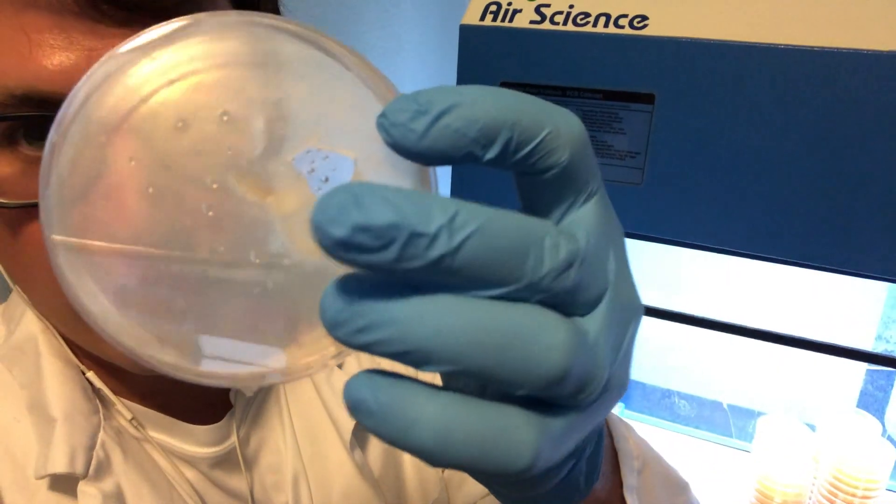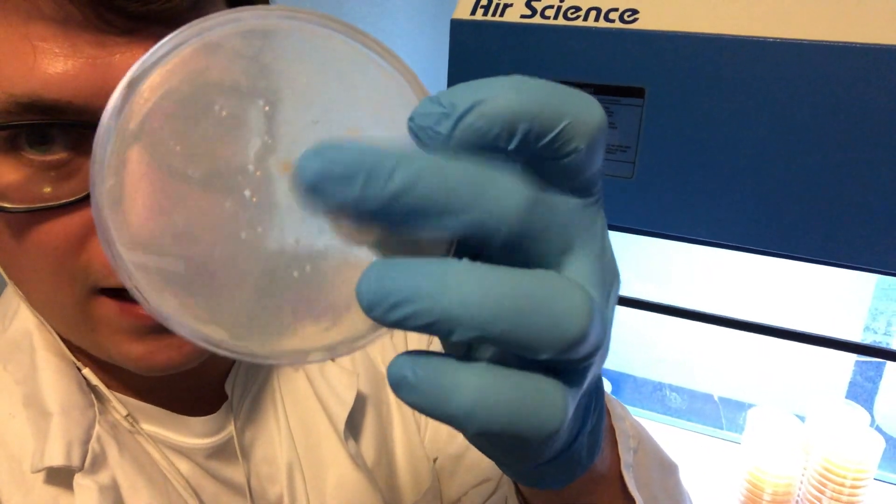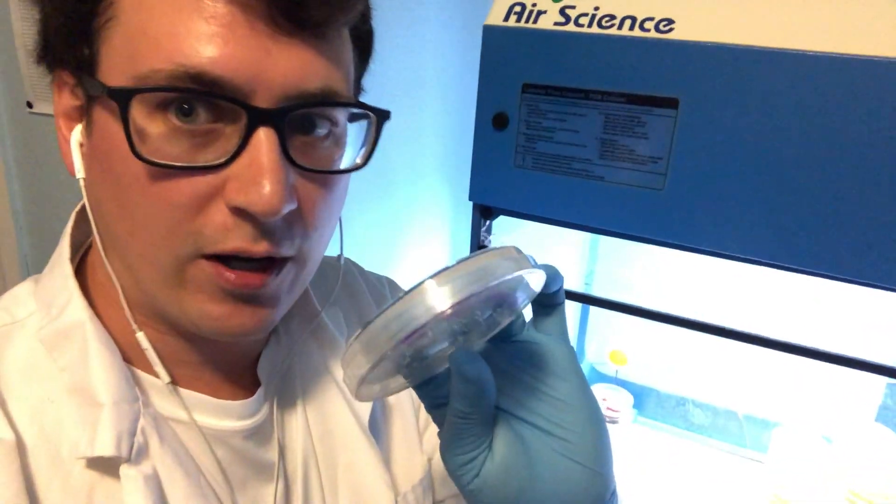This is what happened to the elm oyster too, so I kind of left that alone but I transferred the water agar which is the mycelium right here. The principle with the water agar is that it doesn't have any nutrients that would promote other bacteria or mold to grow, but the reserves from the mushroom mycelium cause it to reach out and produce just enough mycelium that we were able to transfer that onto MEA.